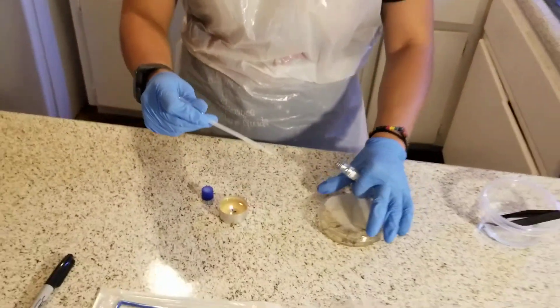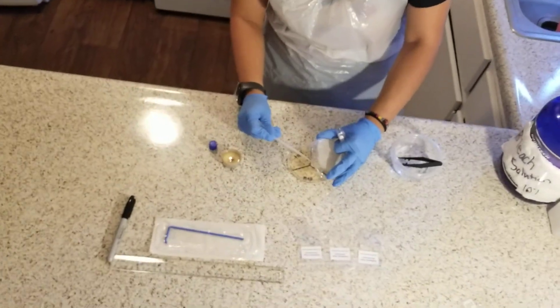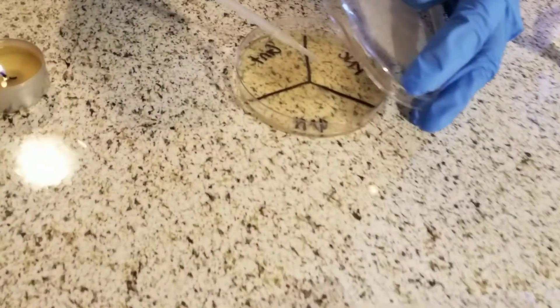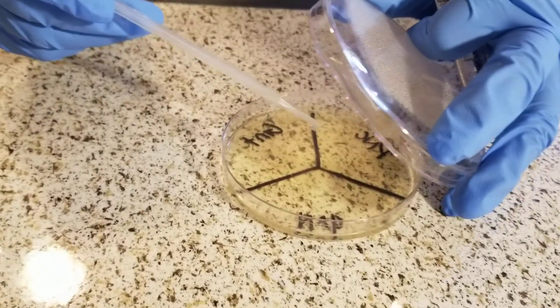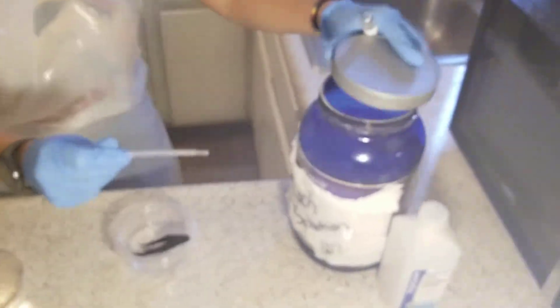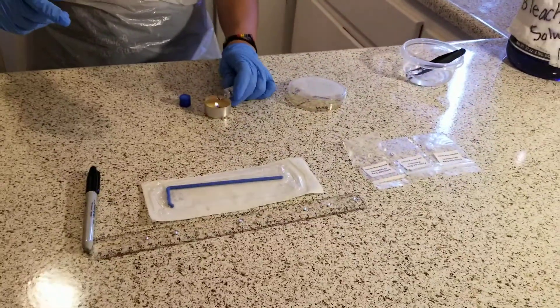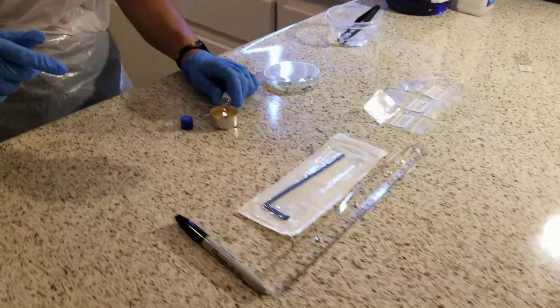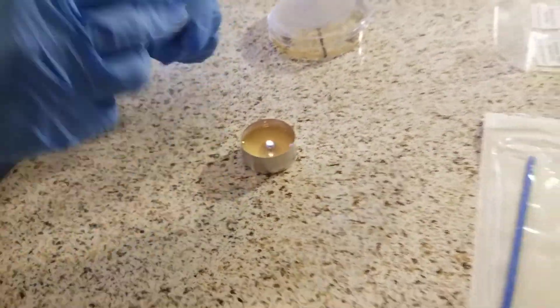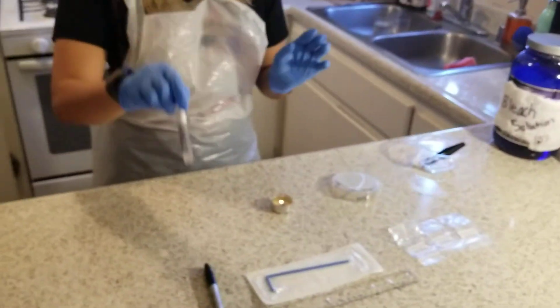Then I will transfer eight drops to my agar plate. I will dispose of the pipette in the bleach. Then I'm going to reflame my active culture and recap it. This will be placed in the refrigerator for future experiments.